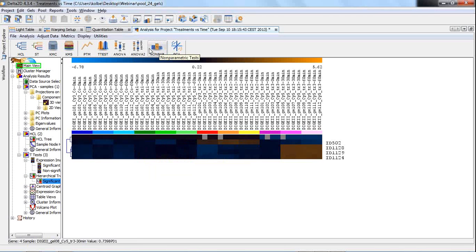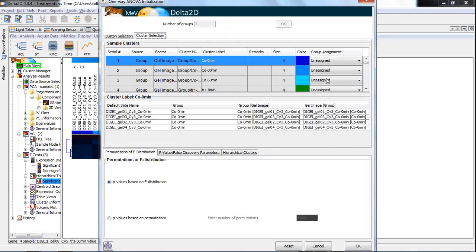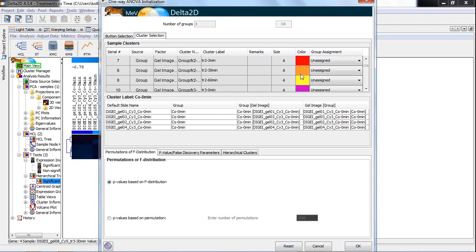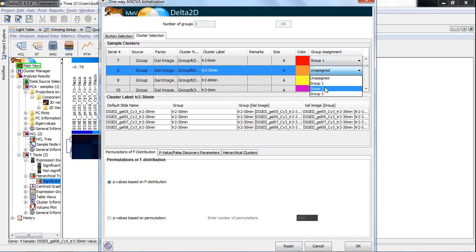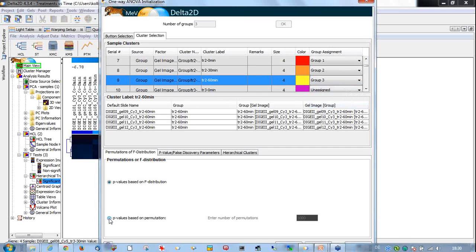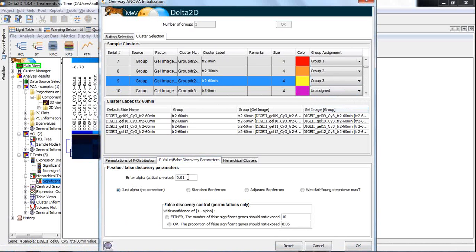Coming to then maybe an ANOVA analysis. Let me show one-way ANOVA analysis. If you have a number of groups, for example 3 groups, since you have 3 points in time, let me then have a look at the 3 points in time of the treatment 2. So treatment 2 0 minutes should be group 1, 30 minutes should be group 2, and 60 minutes should be group 3. We again choose p-values based on permutations. And then we choose again 0.01, and for discovery rate control we want to have a maximum of, well, let's say again 5.